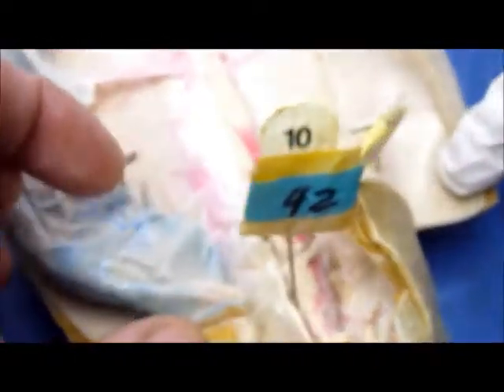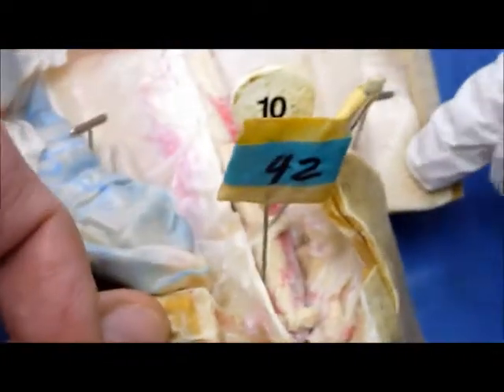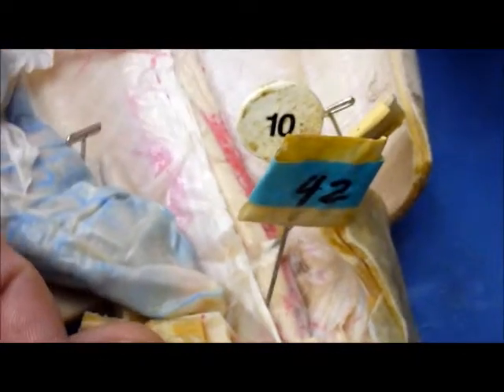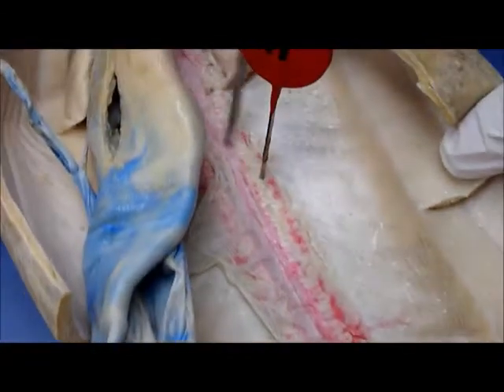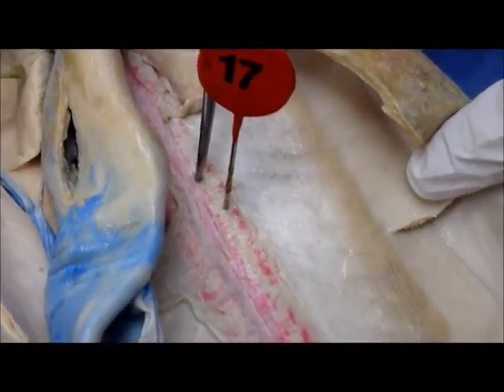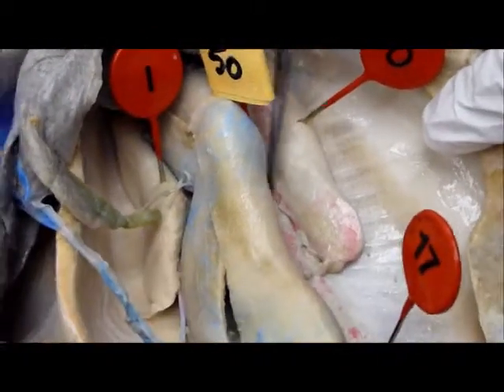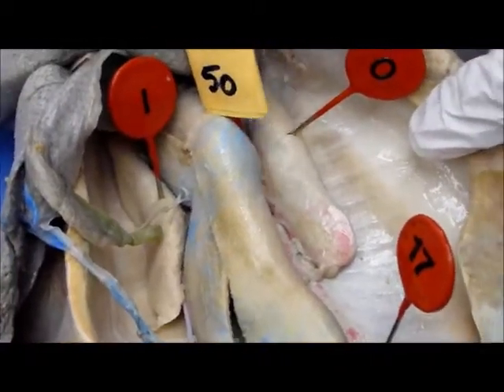Number 42 is the accessory urinary duct — you won't see that it's there. This spaghetti-like stuff is the ductus deferens, and that's the spaghetti stuff under the surface. Keep moving up — we have the testes, I and O, and in the middle is number 50, the mesorchium.